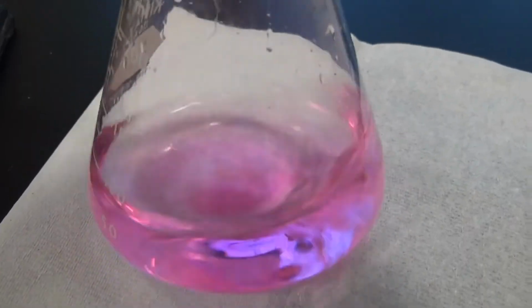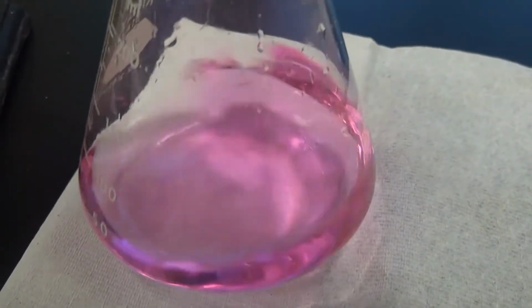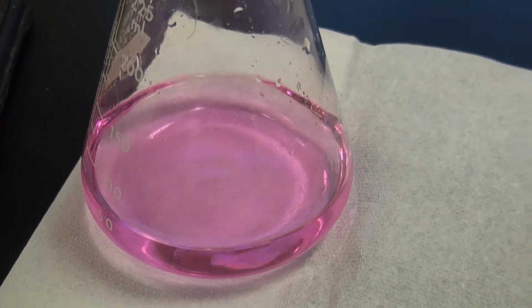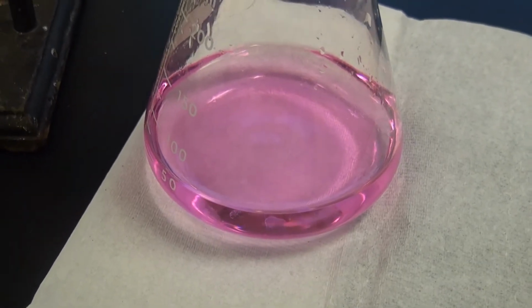All right, that was awesome because that was exactly what I calculated it to be. So my lab assistant did a very good job making up this solution. They did make it up pretty accurately. Okay, so that previous volume right there that we just got is the equivalence point volume we're going to use for our calculation. Okay, on to flask C, and then we'll be done and talk about the final calculations.